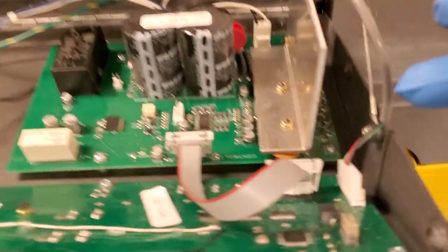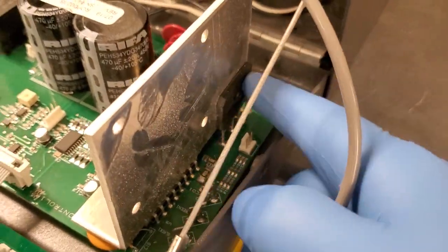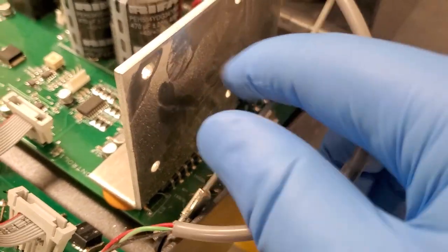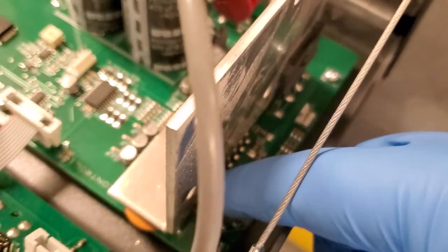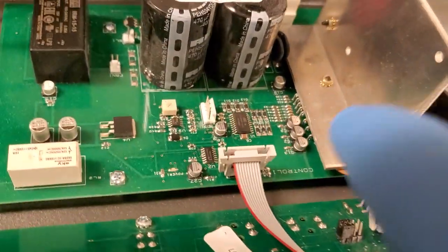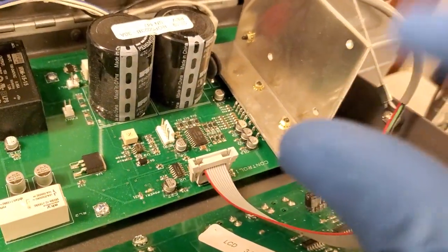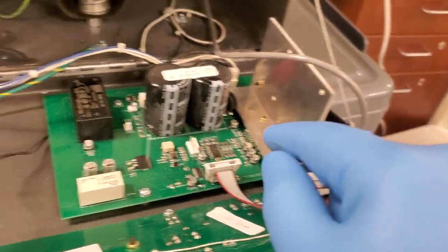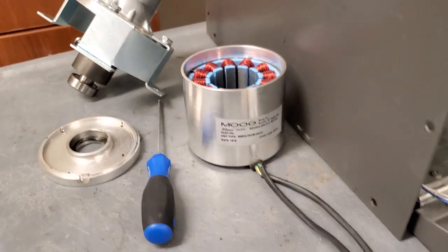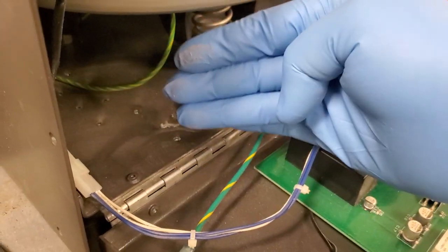And right here is a typical three-phase motor controller. You can see this right here is your bridge rectifier, and down here you can see your driver. Now, I'm not going to take this heat sink off because I imagine there's some sort of heat sink compound under there that's sealing the two together. But that is your motor driver. This is a brushless three-phase motor. And here, you can take a look.